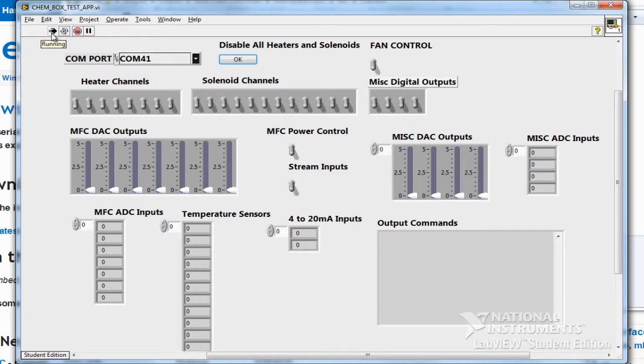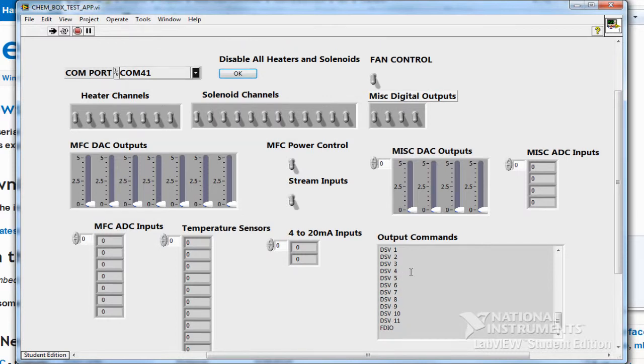and then press go. So what this program does is it basically automates all of those command line strings to control the box. So notice whenever I click on the solenoid channels, it shows me in this window the commands that got sent out to do whatever switch. Now, all of this stuff, for example, the DAC, you can see all the output commands for the DAC. I can slide these up to control the DAC outputs.